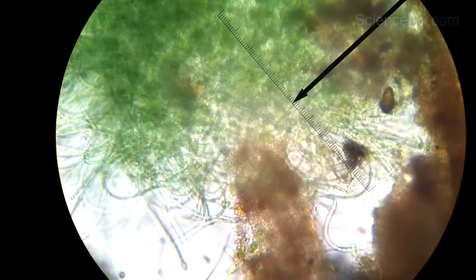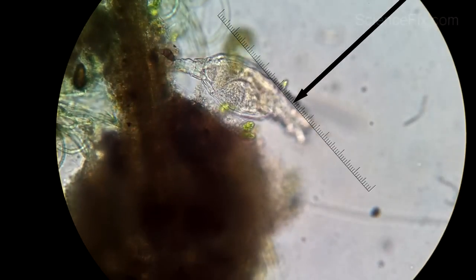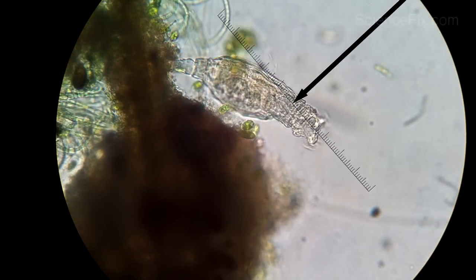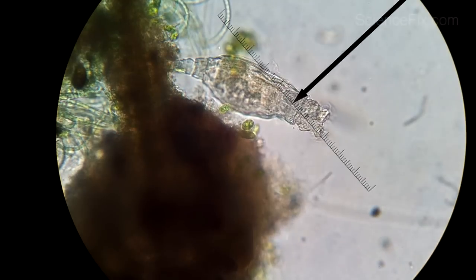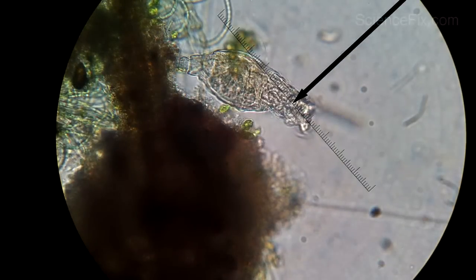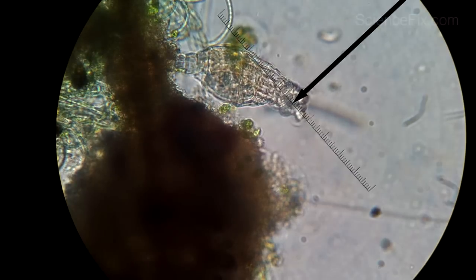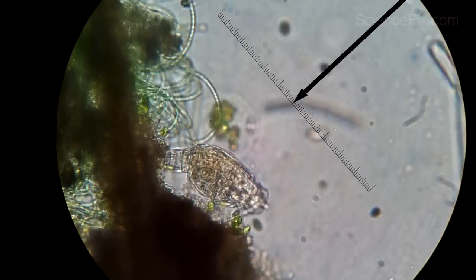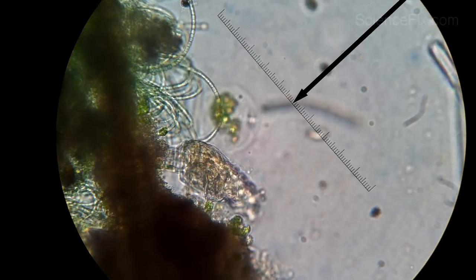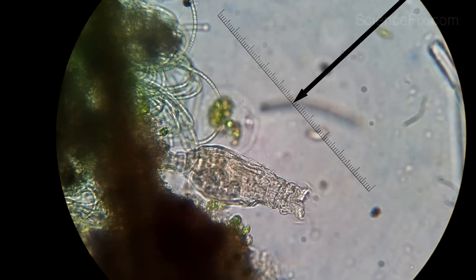Here are some more photosynthetic organisms. And here's a rotifer — a lot of you have probably seen rotifers before. You can see that the base of the rotifer attaches itself to some kind of structure, and then the head has some cilia. The cilia twirl around so that it makes water flow into the organism, sweeping food particles in — that's how it feeds. It's a really neat organism that students will be amazed at, how something that looks pretty complex can be so small and at a microscopic level.